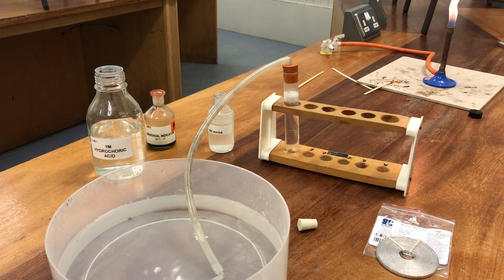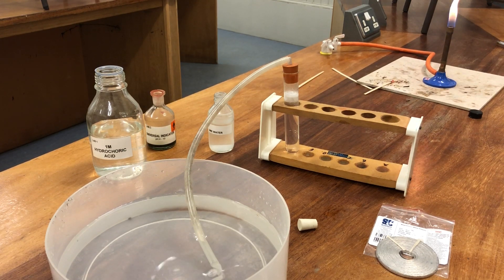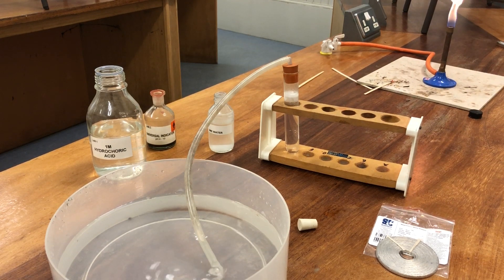Hydrogen is insoluble in water, clear and colourless.